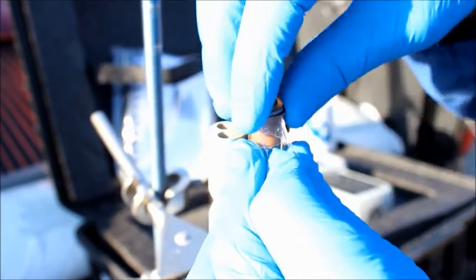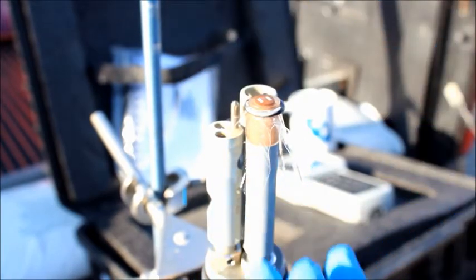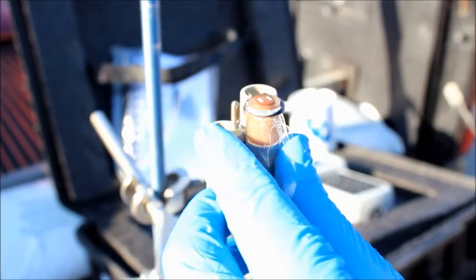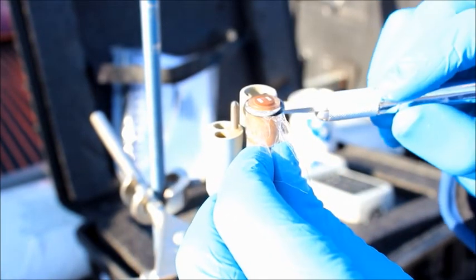If done correctly, the membrane will have no wrinkles and there will be no air bubbles underneath. Finally, he removes the excess membrane.